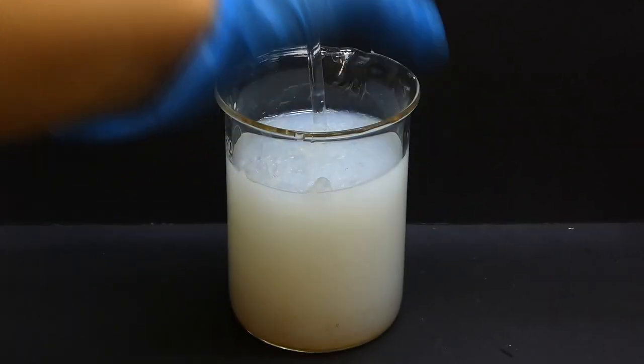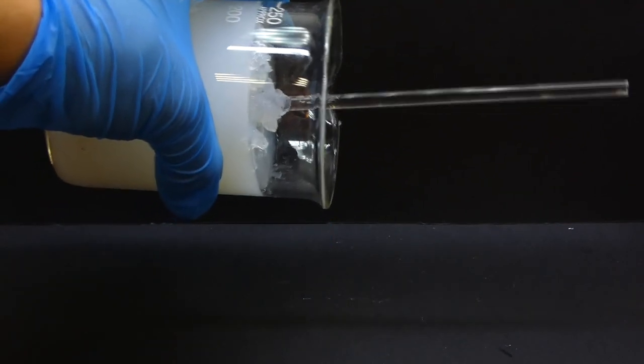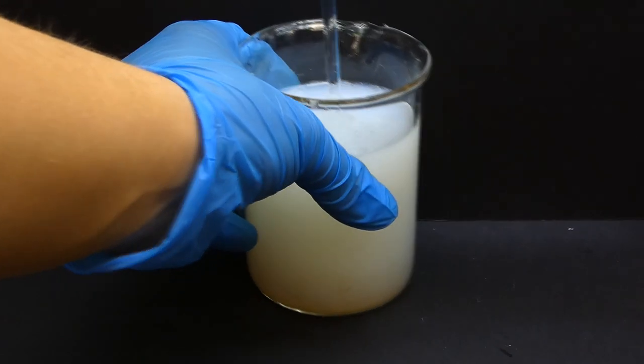I tried to neutralize it using vinegar and citric acid, but instead I made some kind of weird jelly. If anyone has an idea what this might be, please share it in the comments.